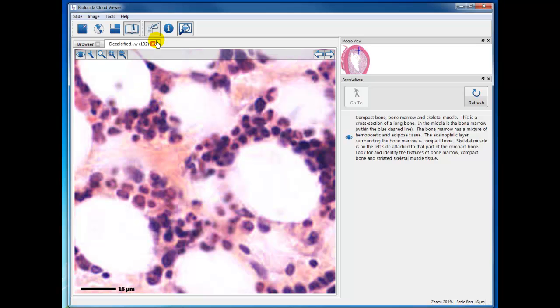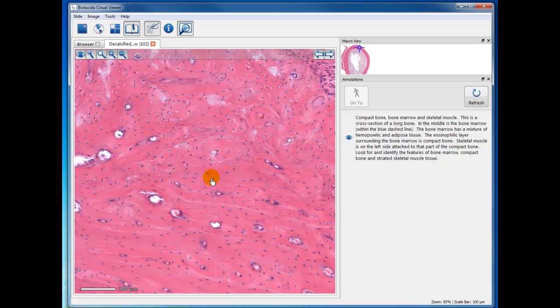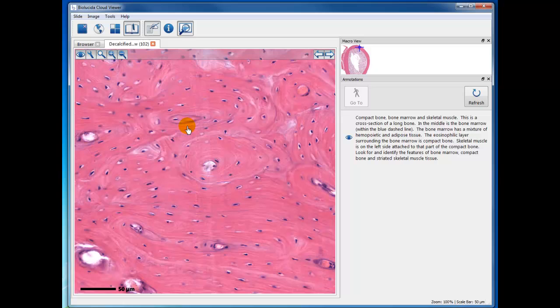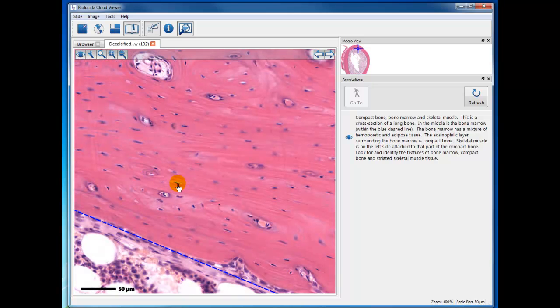Okay, let me go back out here and let's just look at the compact bone tissue. You are learning about bone tissue and its structure, and you see these structures here that have a little opening where blood vessels go. That's the Haversian canal, and around that you have concentric layers of mineralized bone tissue that is composed of collagen arranged in different angles as each layer is laid upon, and then the osteocytes here. Just to point that out, and then in the side here you have interstitial lamella.